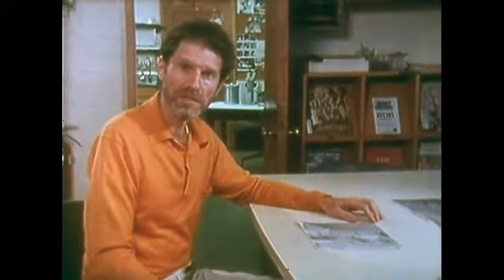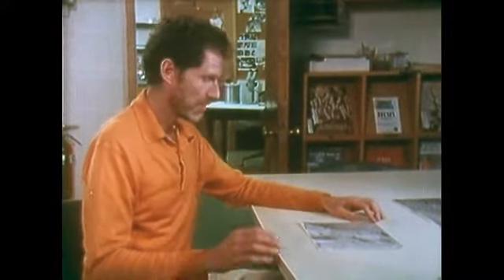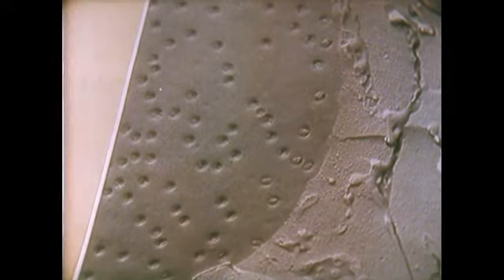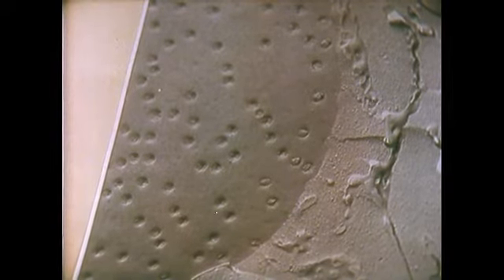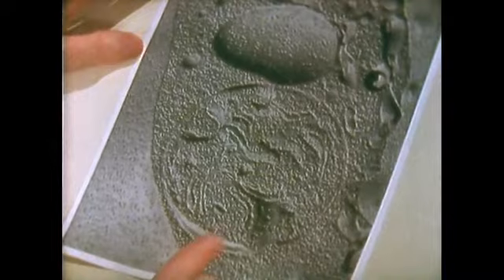What do we see by freeze etching? For example, in this electron micrograph of a freeze-etched replica, we can see the nucleus with its pores, and out in the cytoplasm, endoplasmic reticulum. In this micrograph, at higher magnification, we can see a mitochondrion which has been cross-fractured, and inside the mitochondrion we can see cristae with some of the fracture faces exposed.